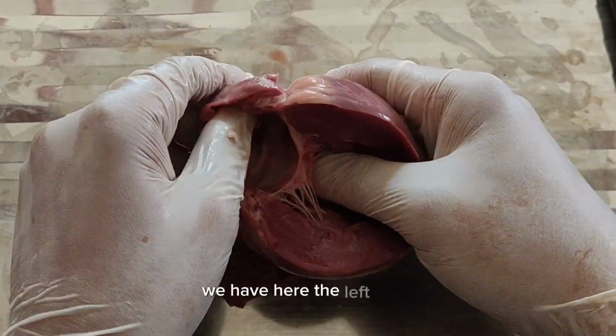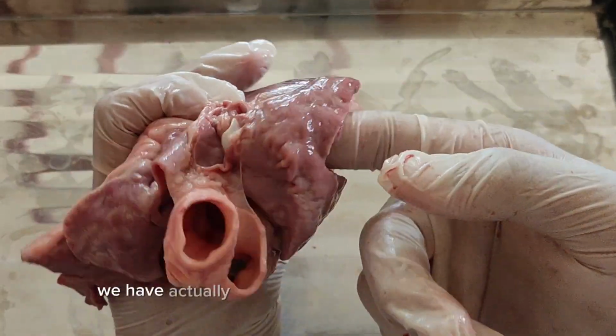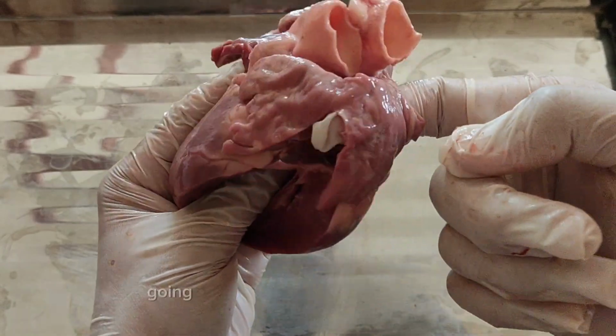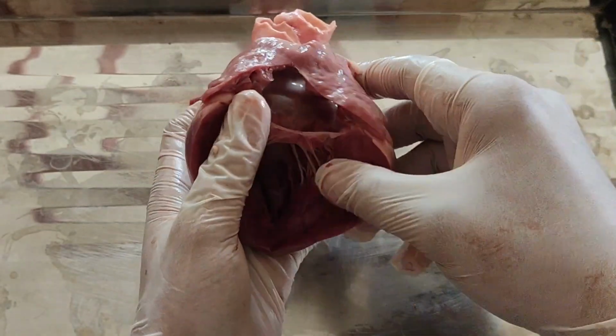We have here the left atrium. Let us find the openings of the pulmonary veins from the lungs. Here we have the pulmonary veins, still intact. So, pulmonary veins, left atrium.